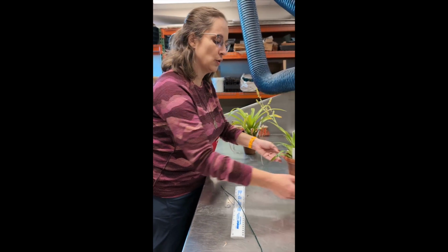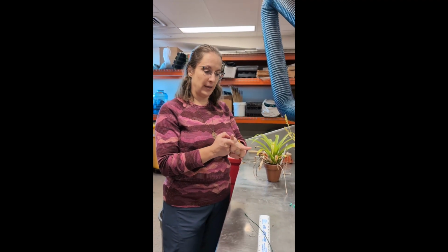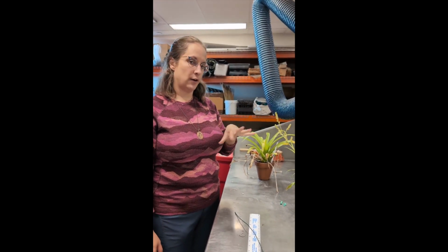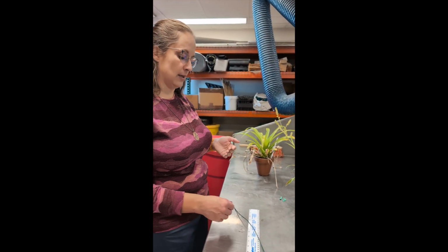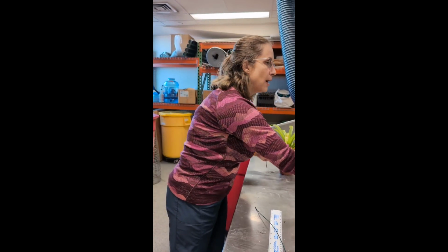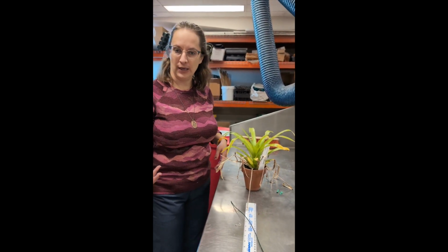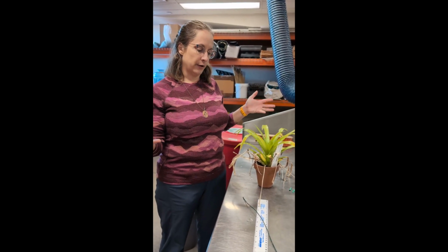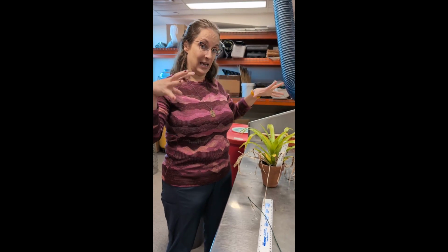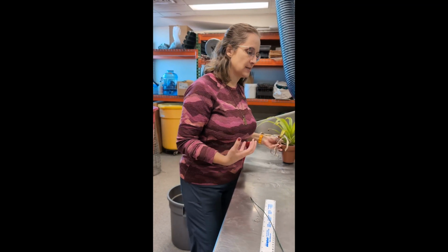So I'm going to teach you two quantitative or numerical values we can take on plants at different intervals of time, and then what to check for with those meristems periodically as well. I'm going to show you longest leaf length and number of chlorophyllous leaves. That's just a fancy way of saying the number of green leaves. Bromeliads can build their bodies and make them bigger by adding more leaves and lengthening leaves. So we're going to capture that here with these plants.